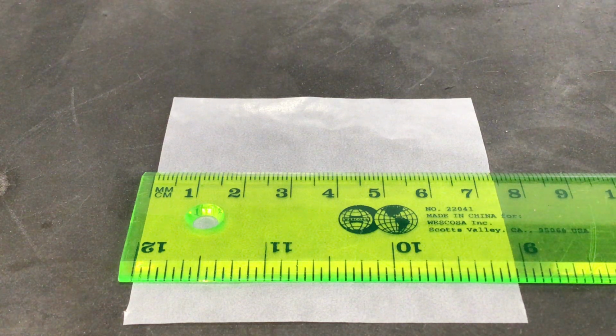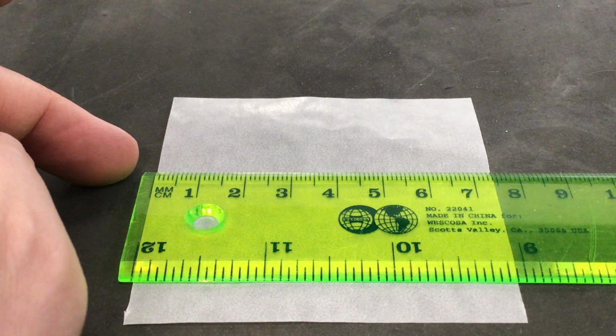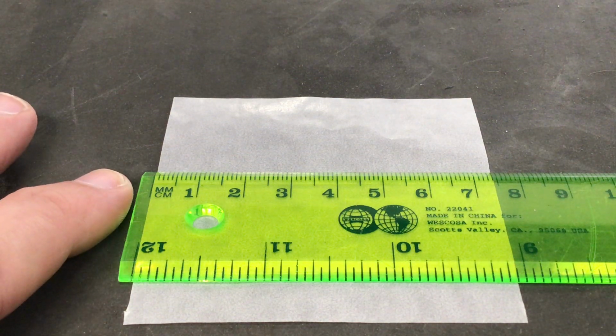So looking at the ruler that we have right here, we'll notice that the very top line on this has tick marks of every millimeter, with the larger numbers like the 1, 2, 3, 4 readings being in units of centimeters. That's effectively what they're trying to show with the labels that are over here.